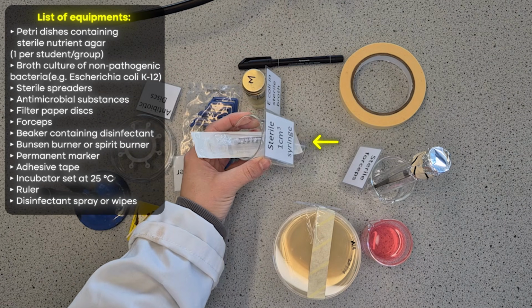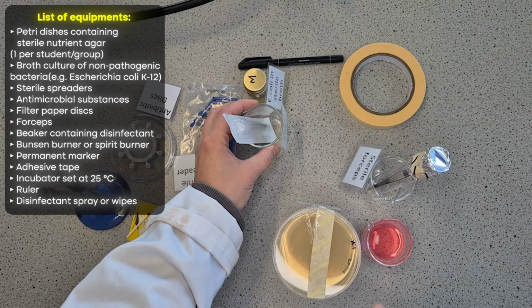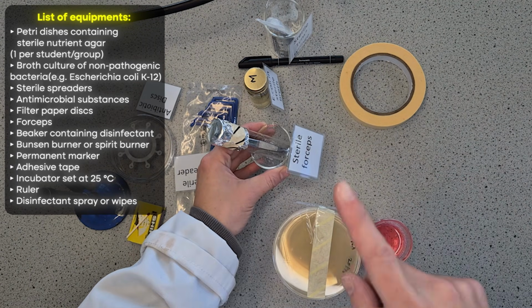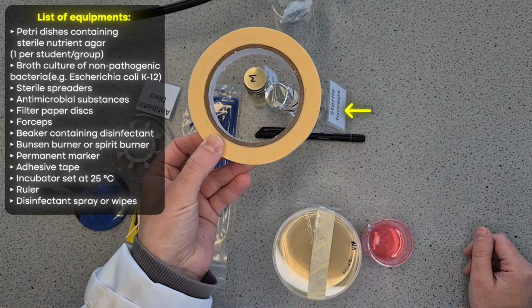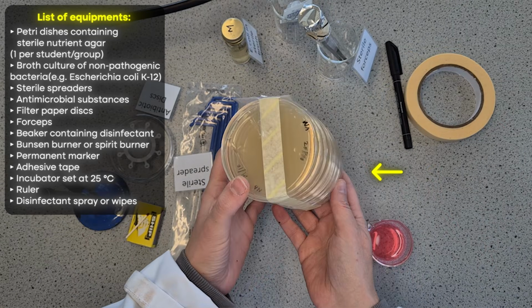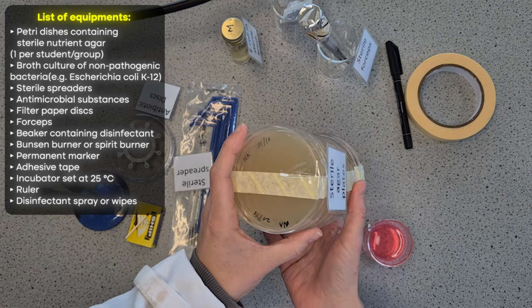I also have a sterile syringe to use to transfer the bacteria onto my plates. I've got my pre-sterilized forceps to move the antibiotic disc onto the plates. Permanent marker to label the Petri dishes, tape to tape down the lid of the Petri dishes. I've got pre-poured agar plates, which are all sterile. So we've got sterile agar plates pre-made.